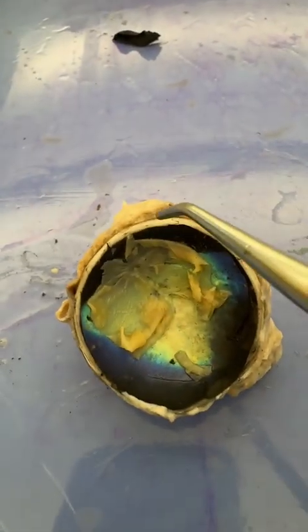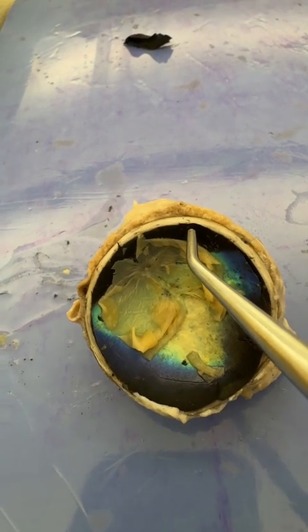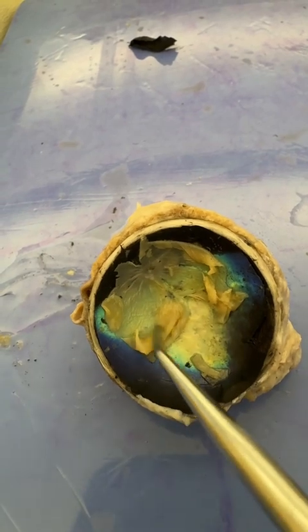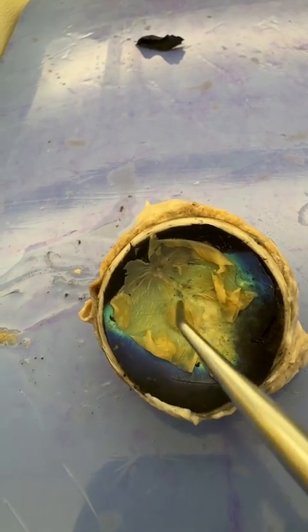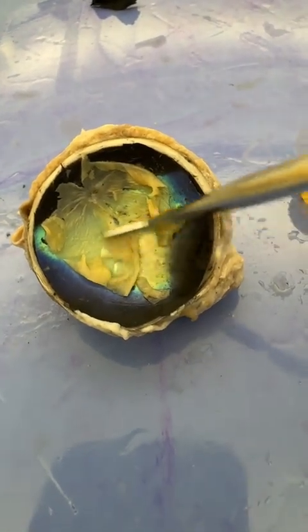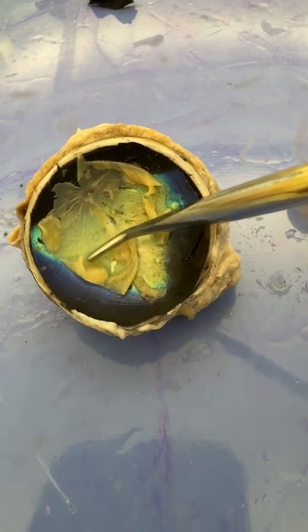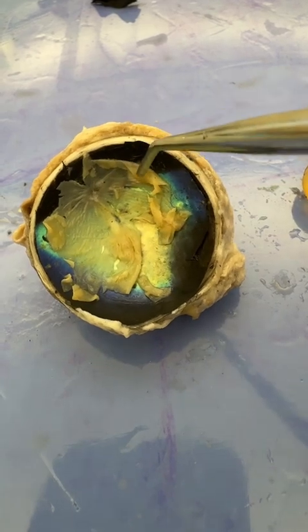And now we're on the back side of the eye. You can see that sclera layer very nicely, that white layer. There's some of the choroid. And then this is the retina. The retina is the part that can actually receive light signals. It's got photoreceptors. The photoreceptors are rods and cones. So those are all on this retina.